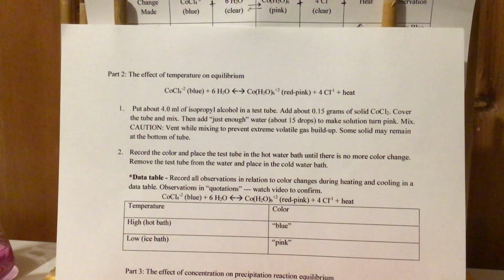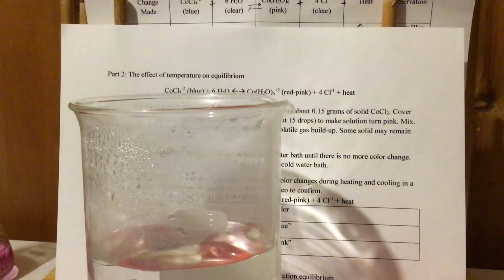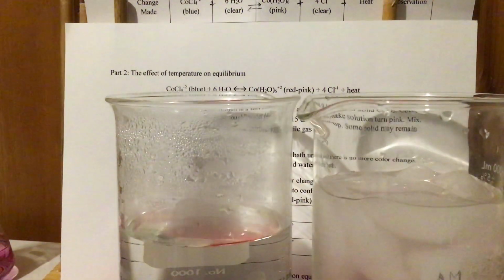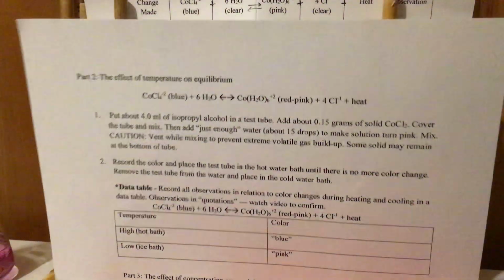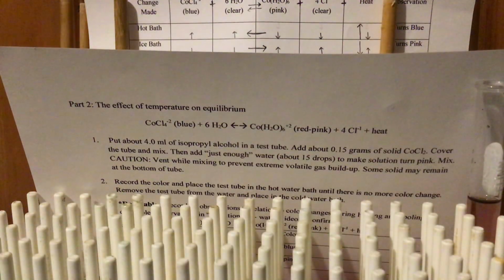So let's take this substance and let's get a couple baths right here. Here's a hot bath over here. Here's an ice bath right here. I don't know if we can prop those up a little bit more. I think we can. Let's try to do this. And here we go. We got our hot bath here, and we got our ice bath here.